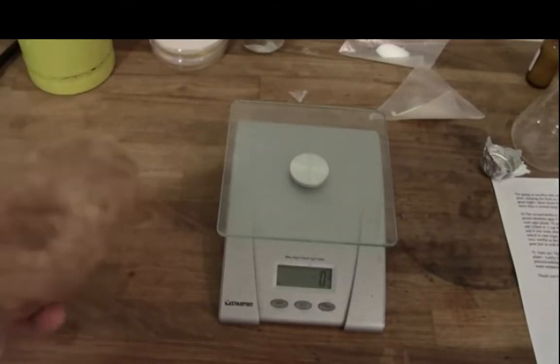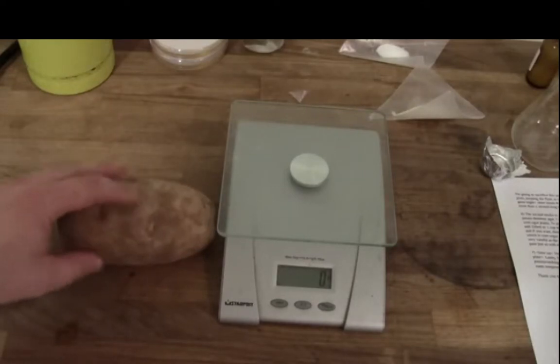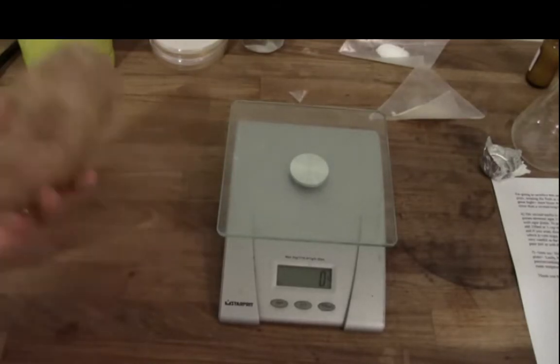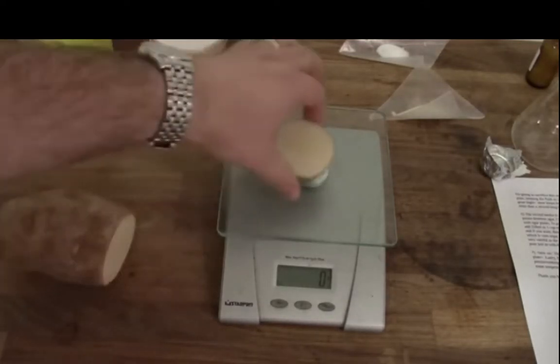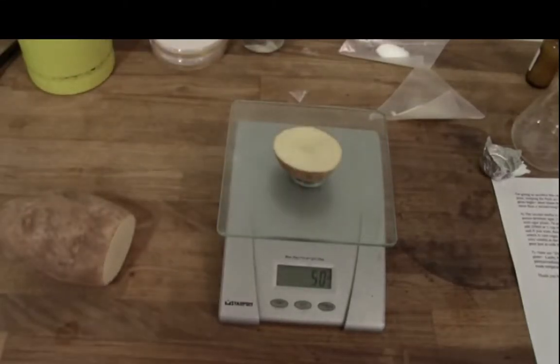Well, I'm going to use this to make a classic media from microbiology called potato dextrose agar. This is often used for growing bacteria such as Lactobacillus and Pediococcus. It's also used for growing fungi, which would include yeast. And the nice thing about it is it's dirt cheap. I mean, you literally need potato and corn sugar to make this. So what you want is about 50 grams of the potato, which isn't very much. Look at that, dead on 50 grams. I'm getting good at this.